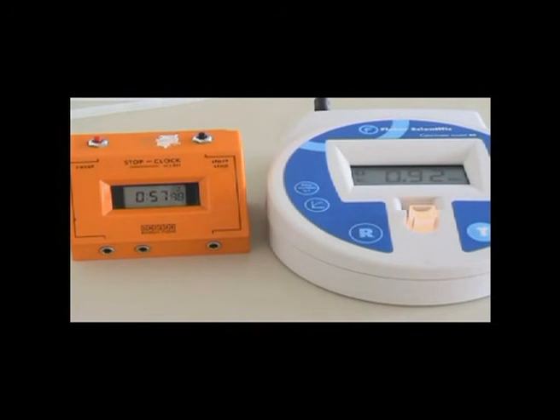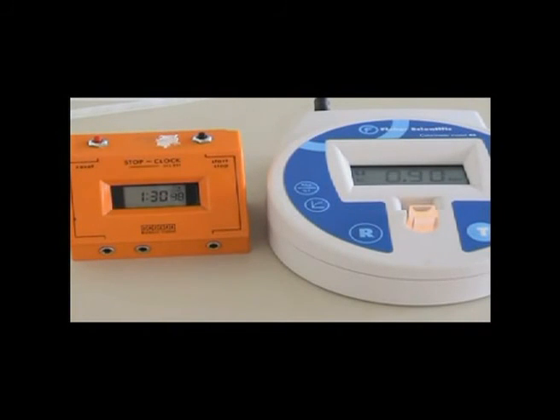With these final few enzyme concentrations, you'll notice that the time period has been edited out so that you just see what's happening every 30 seconds. This saves time watching the film.